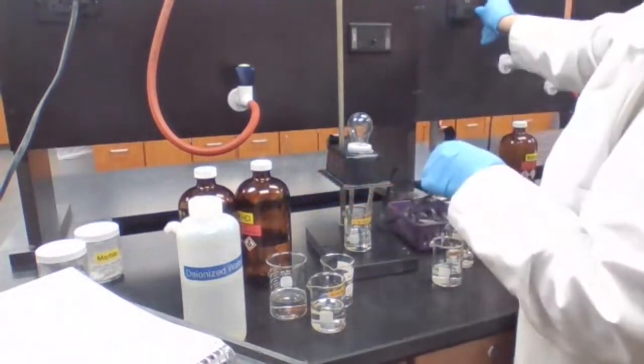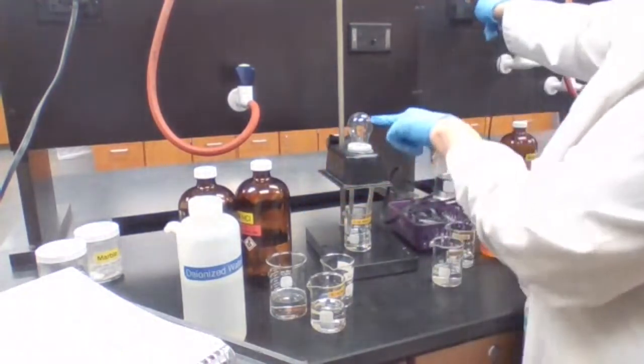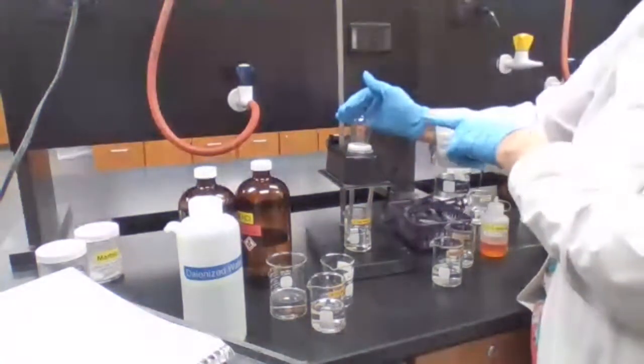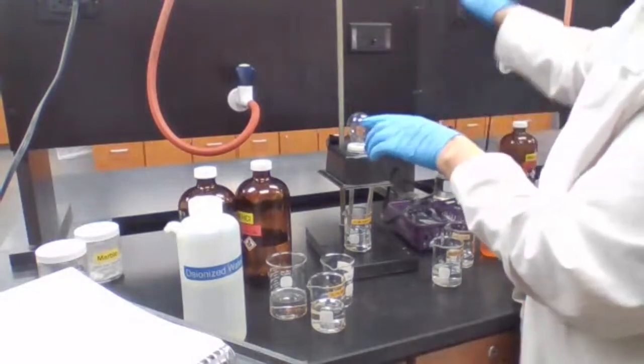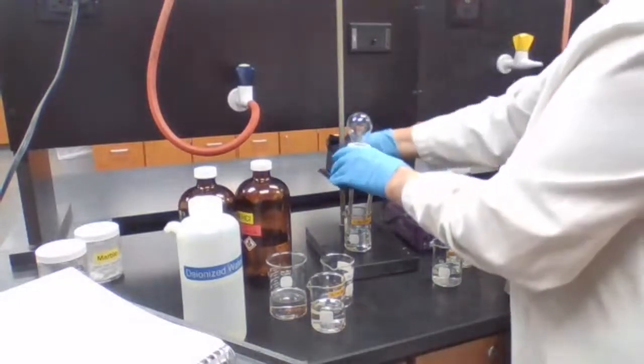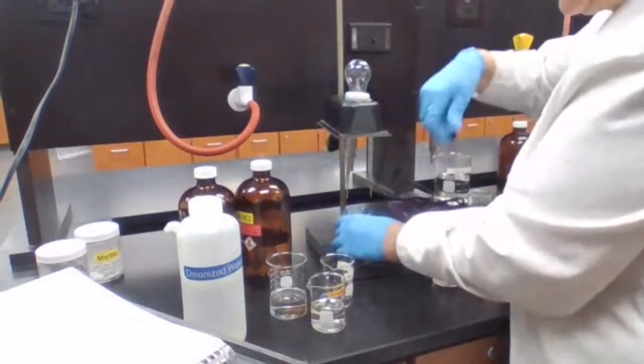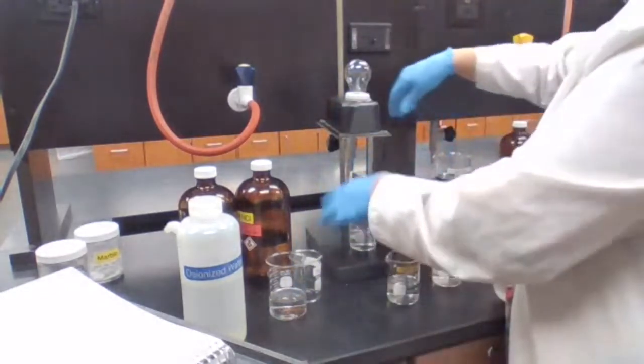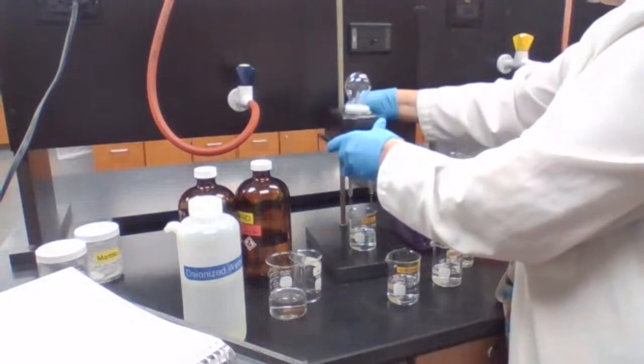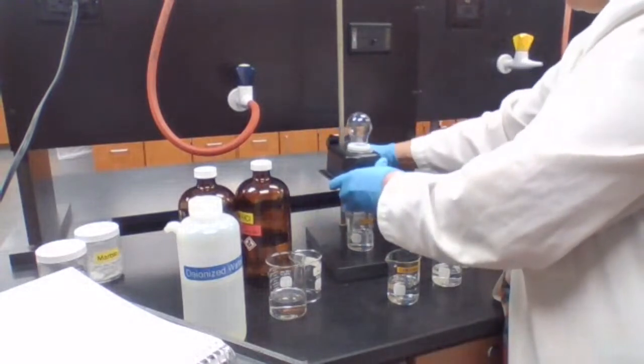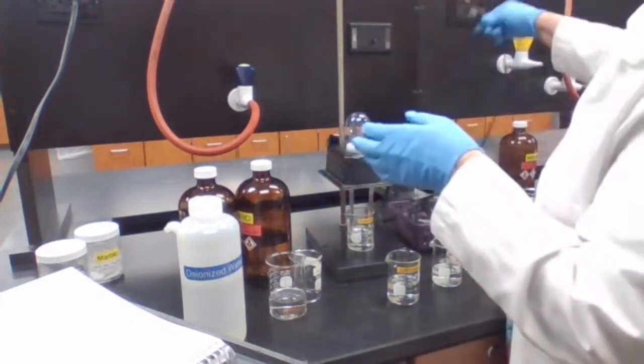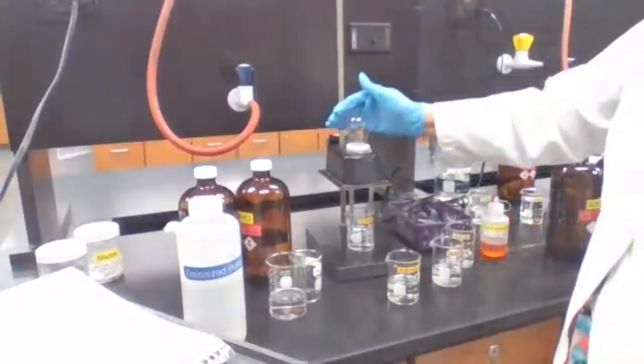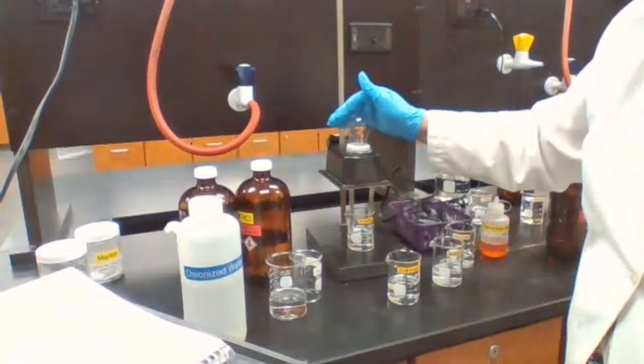And then we have aqueous ammonia. Ammonia in water shows very dim light, even if there is, it's very hard to see it for you.